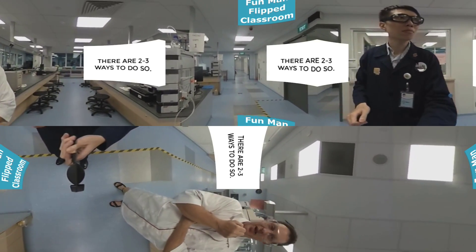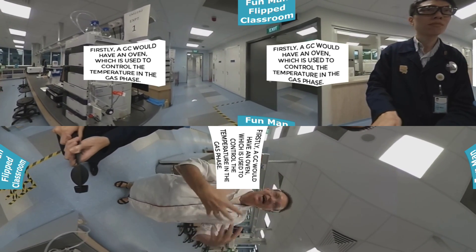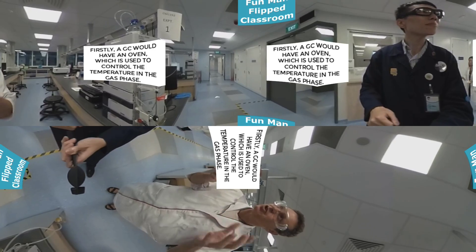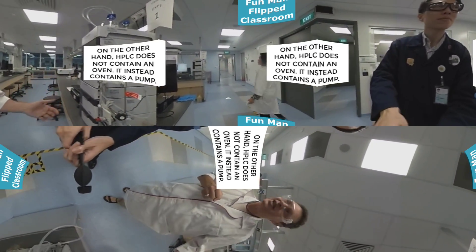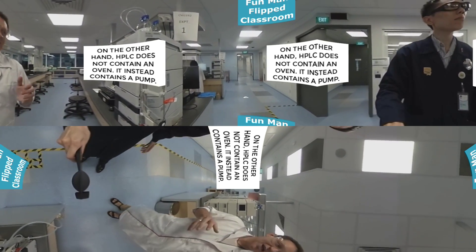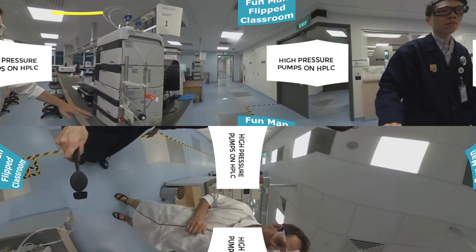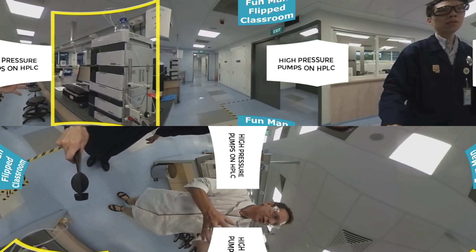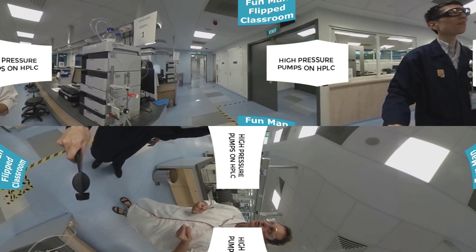There are two or three ways you might know. Firstly, a GC — we'll look at one in a moment — has an oven, because it uses the oven to control the temperature and gas phase temperature. There's nothing here which is an oven. It's liquid pumps, which gives you a big clue that it's liquid chromatography rather than gas chromatography. You've also got pumps here which are high pressure pumps, and that makes it a high pressure liquid chromatography.